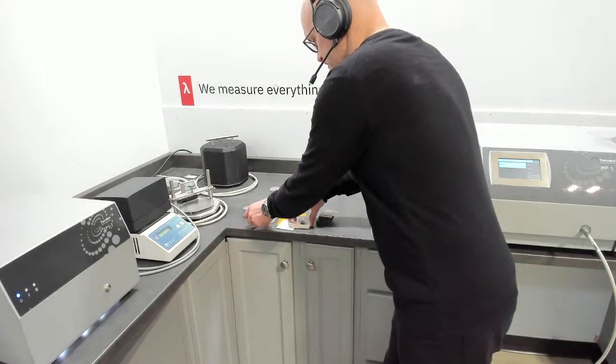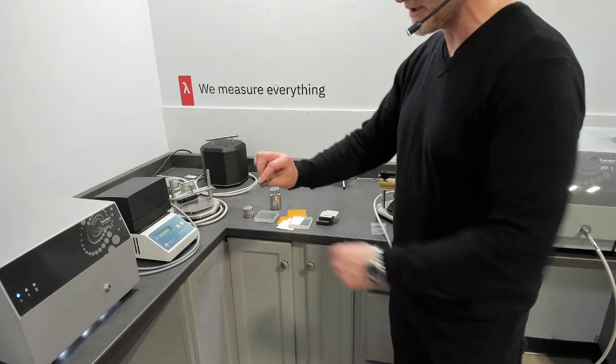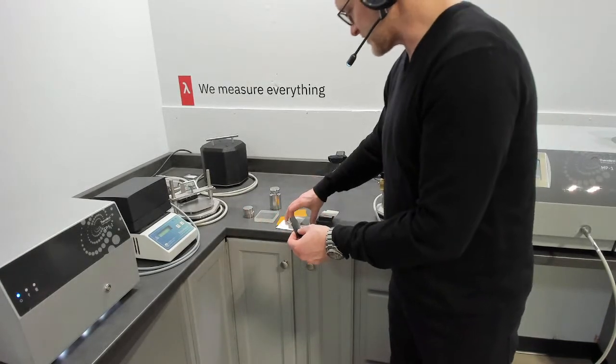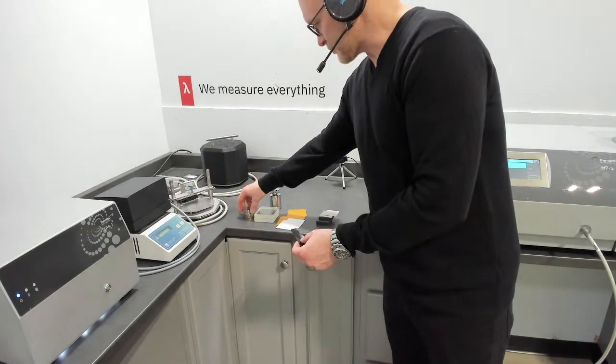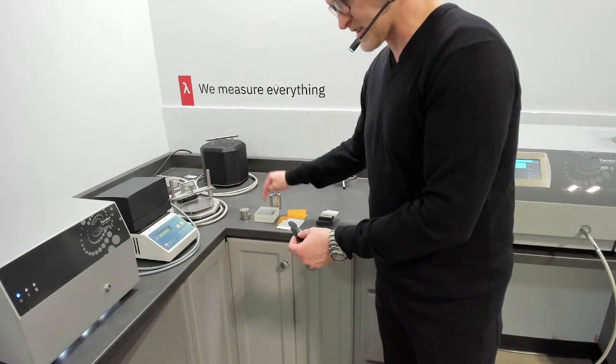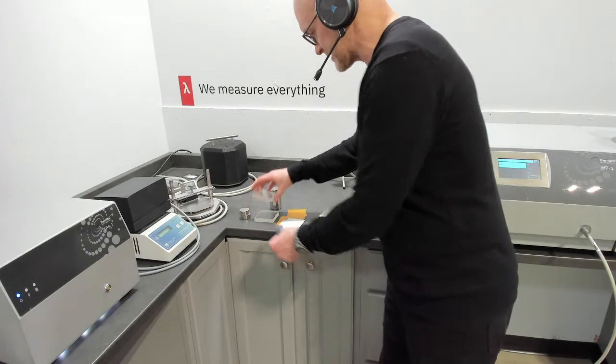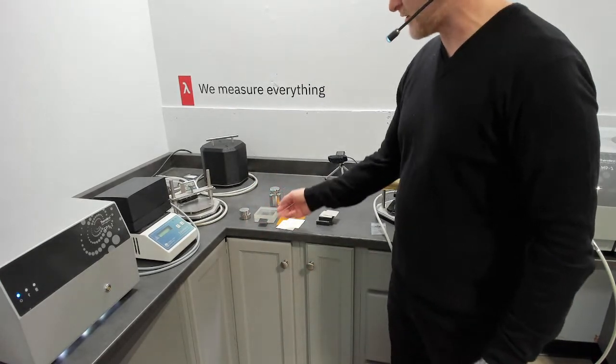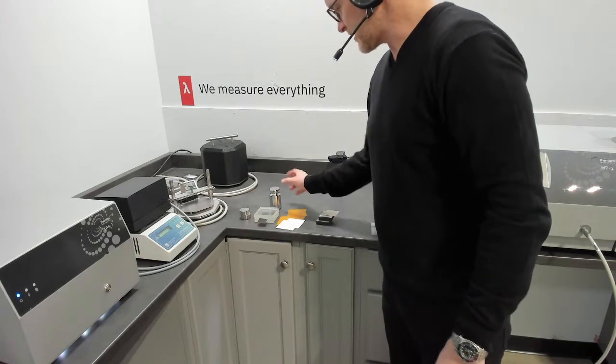So that is an approach where we have a specifically designed thin film sensor. So it has a higher amount of nickel to increase sensitivity. That is a two-step process where you're putting the sensor between your selected backing material. In this case, we can do step one in between Pyrex. Pyrex is nice also visually because you can see the setup.